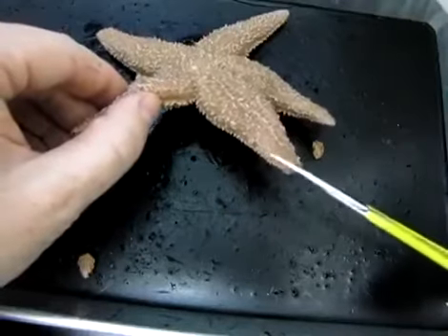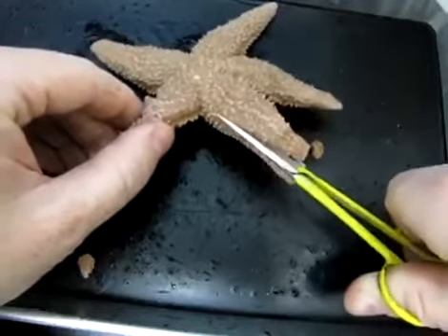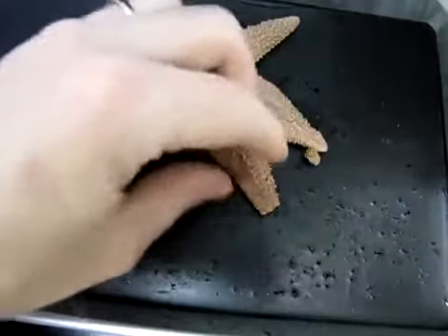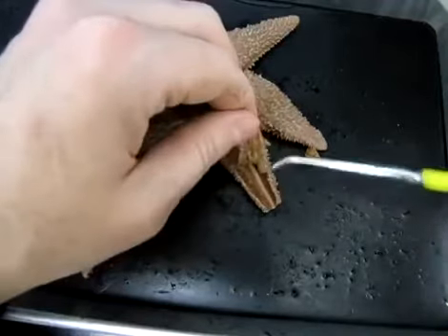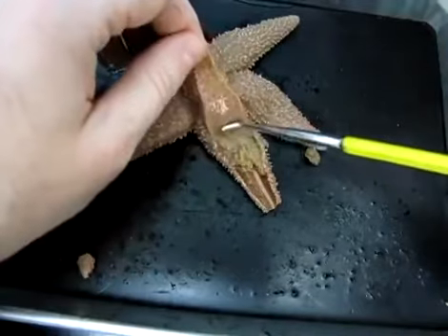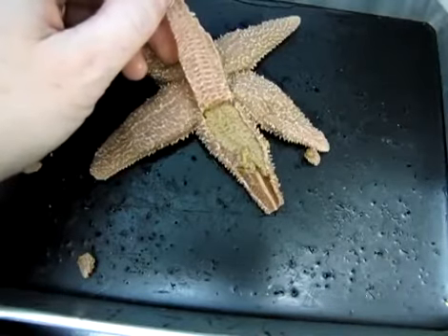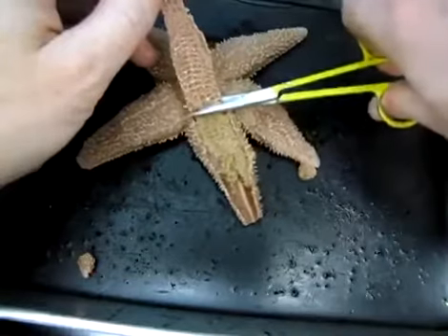So you'll make a total of 2 incisions. Try to keep your blade as close to the skin as possible so as to not damage the structures underneath. And once you've done that, you should be able to lift the skin. You'll want to do so carefully because, as you can see, there are some structures that want to adhere. So you can use your probe or a finger to leave things behind.